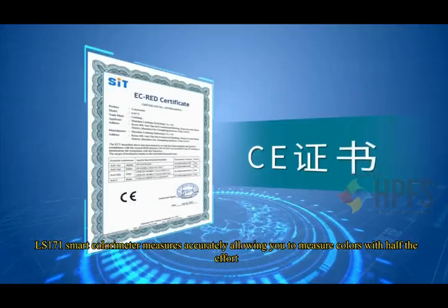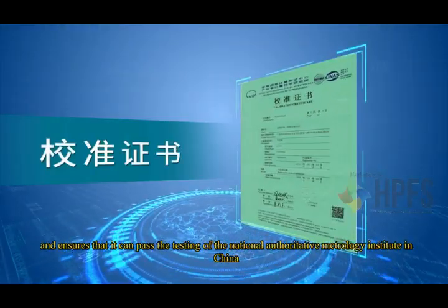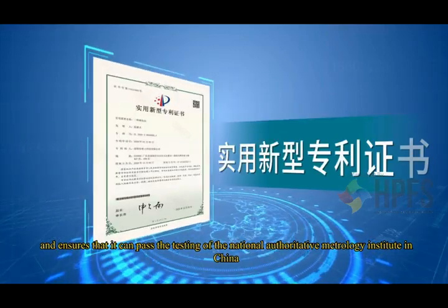LS171 Smart Colorimeter measures accurately, allowing you to measure colors with half the effort, and ensures that it can pass the testing of the National Authoritative Metrology Institute in China.